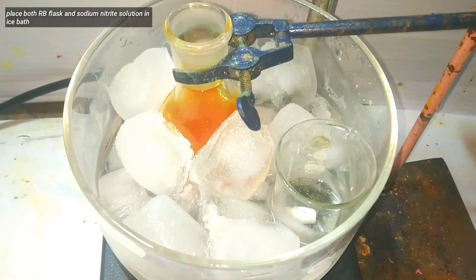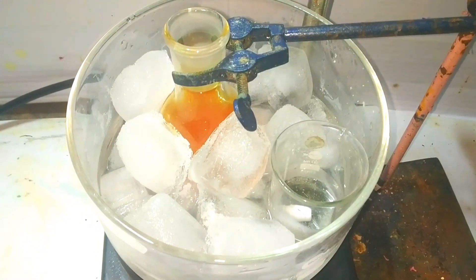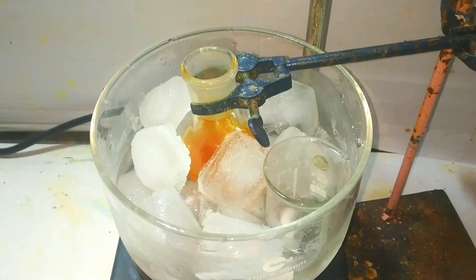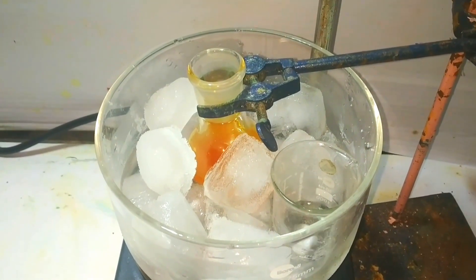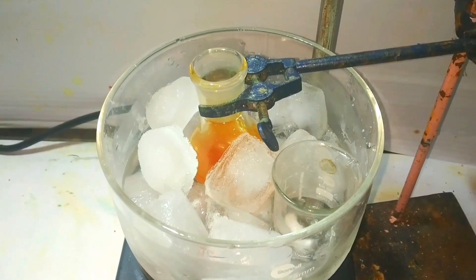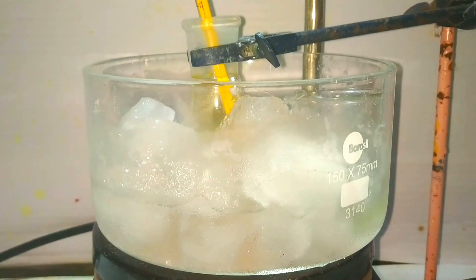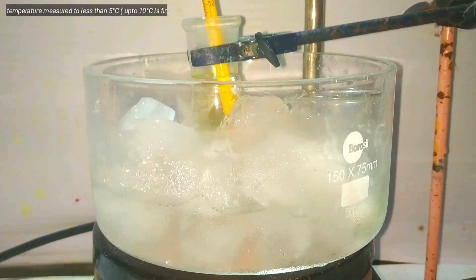After getting a clear solution, both the flask and the sodium nitrite solution are placed in an ice bath. We use a thermometer to make sure that the temperature is kept below 10 degrees Celsius.